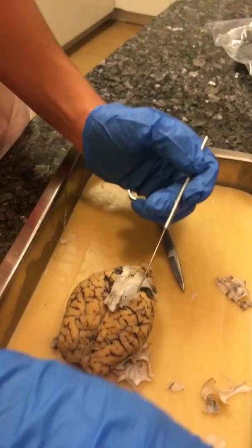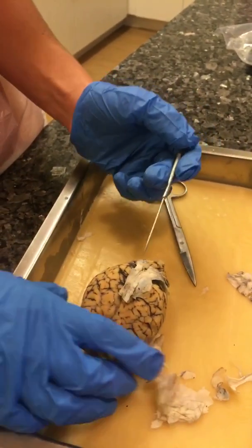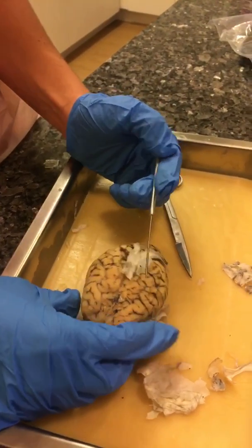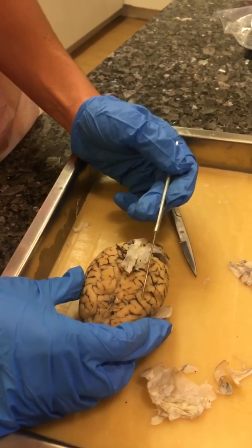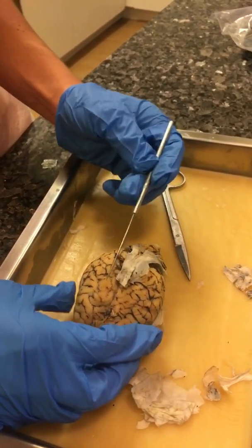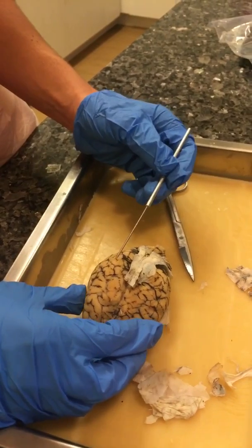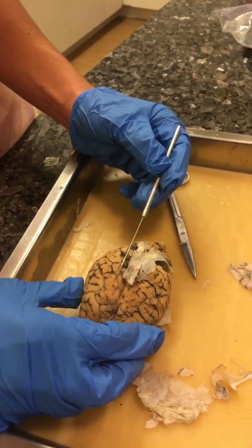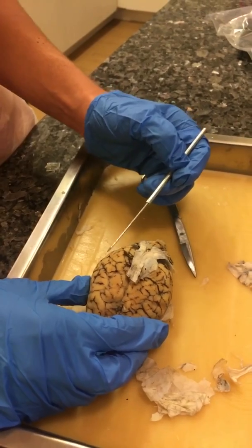For the meninges, we have the dura mater, which I already cut off. The arachnoid mater is supposed to look like a film on the brain, but it's hard to see. And the pia mater layer you can't see — it's below the arachnoid layer.